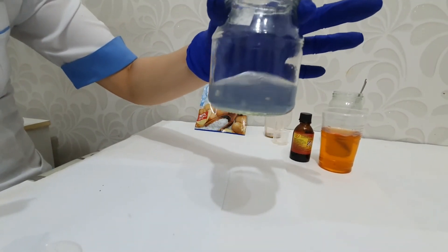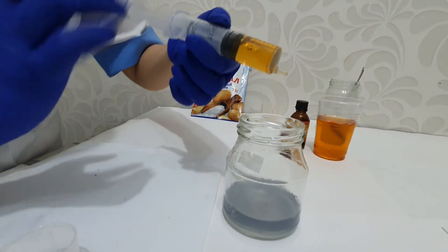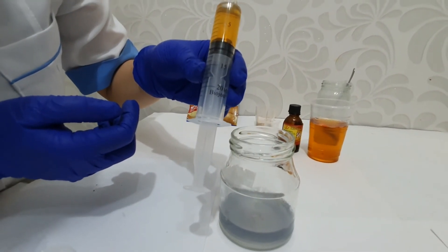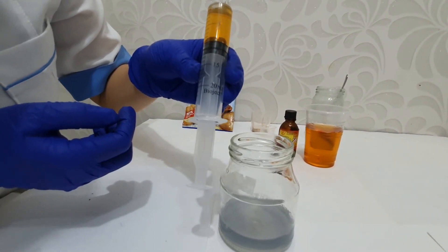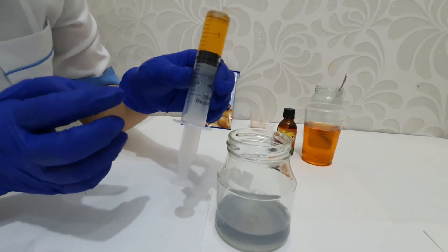This light blue color is the endpoint of titration. I'm going to record the value of the syringe — it's 8 milliliters left. That means we used 20 plus 12, so 32 milliliters in total.